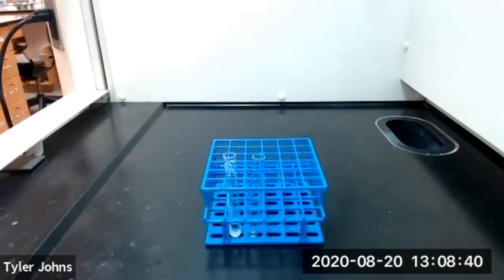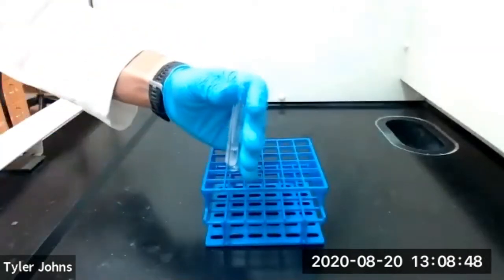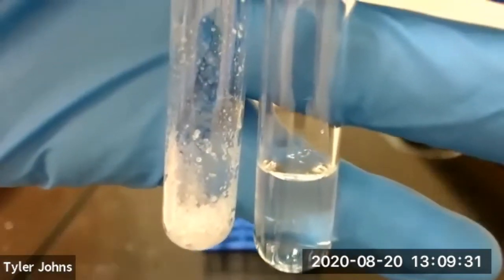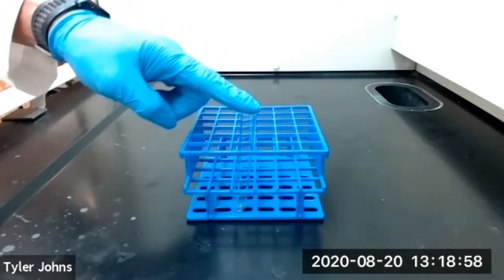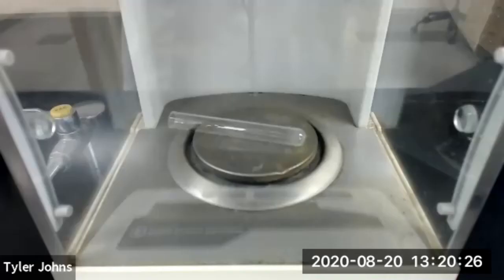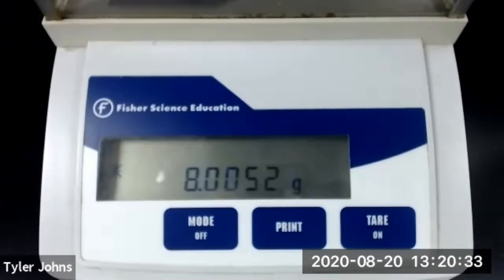We'll now transfer our dried organic methylene chloride layer to a new test tube using a filter tip pipette. We've evaporated all of the methylene chloride from our test tube, so we'll now weigh the test tube to determine the amount of succinic acid that was in our methylene chloride layer. The mass of our test tube and succinic acid is 8.0052 grams.